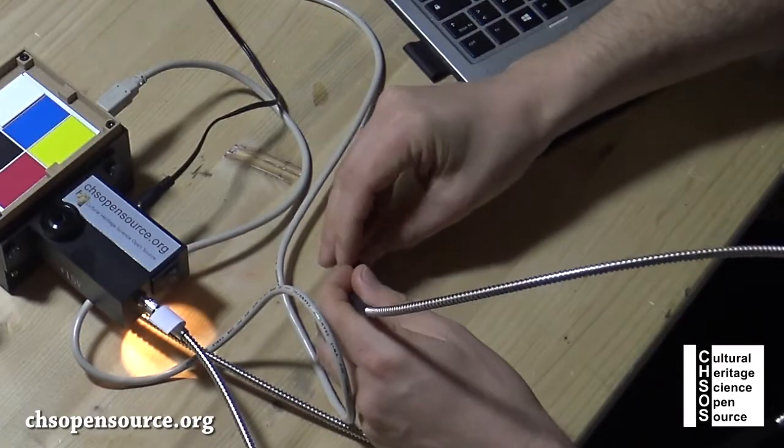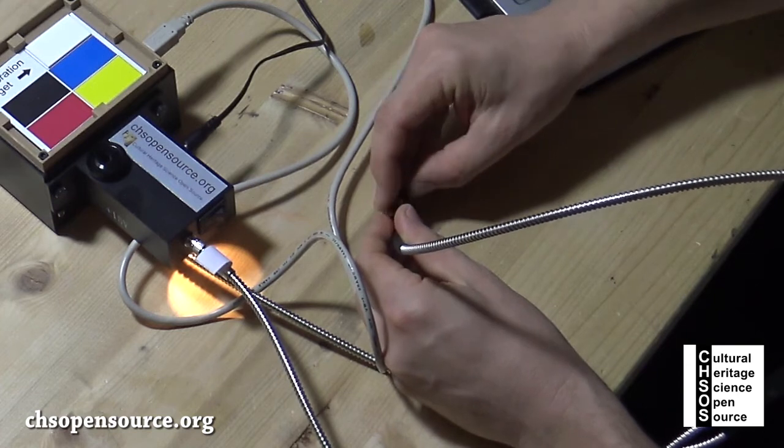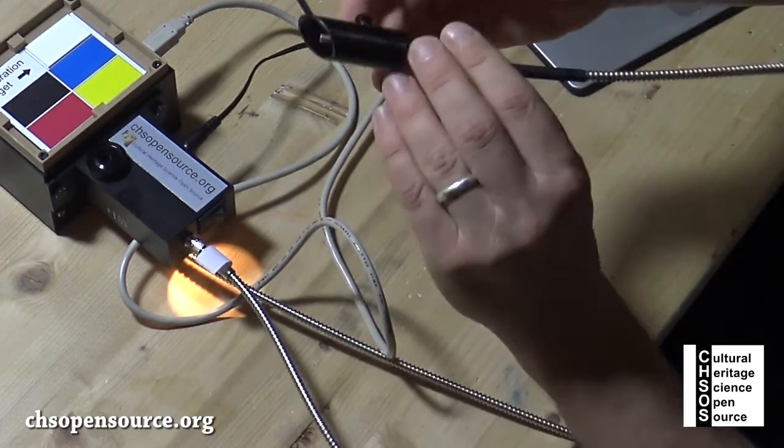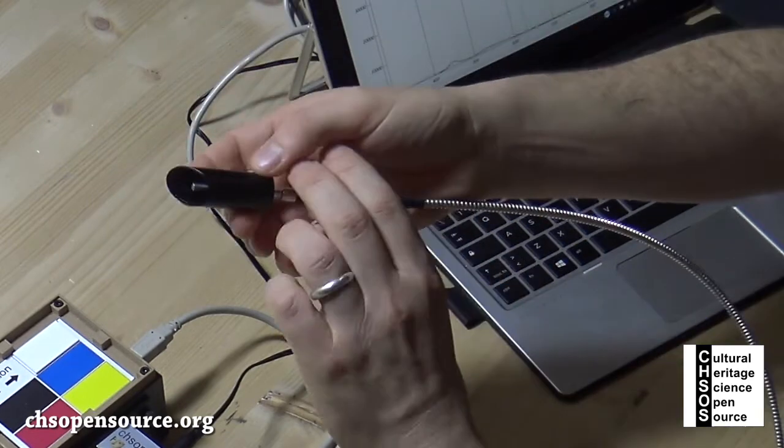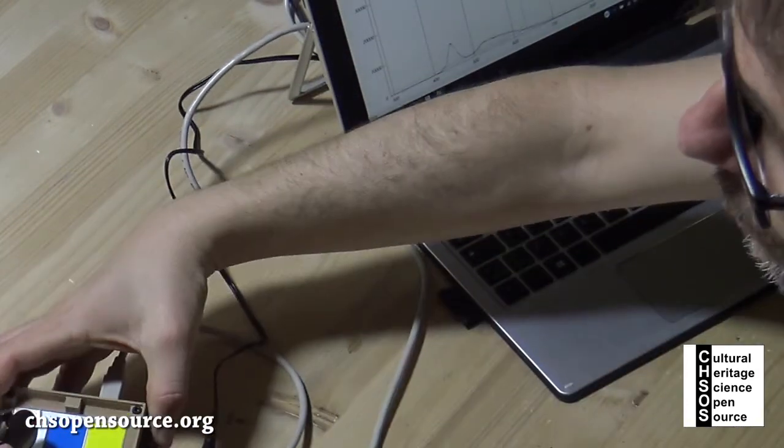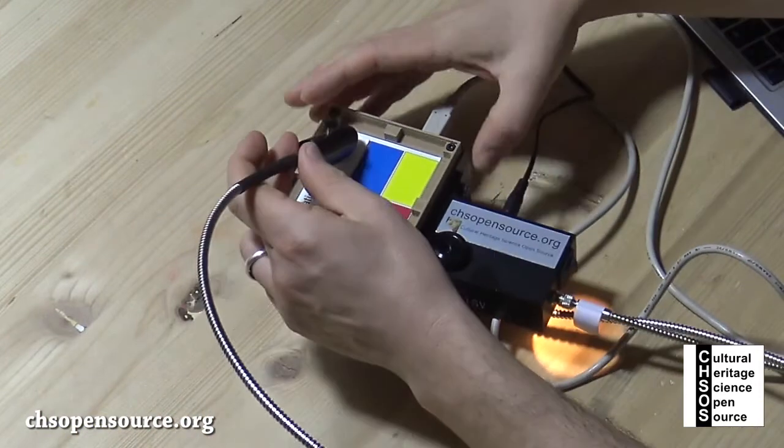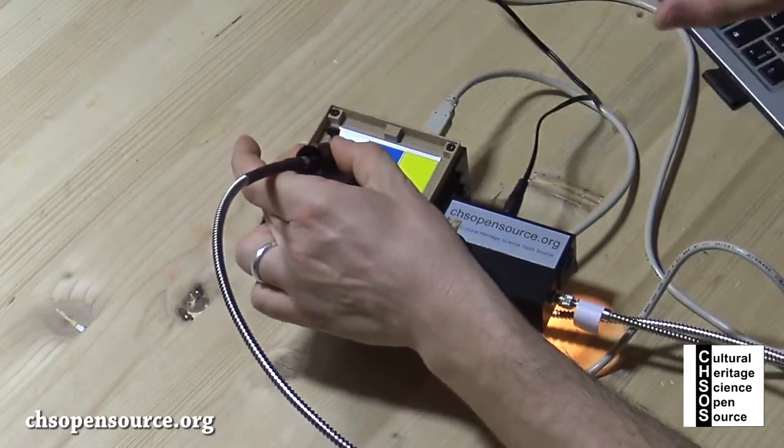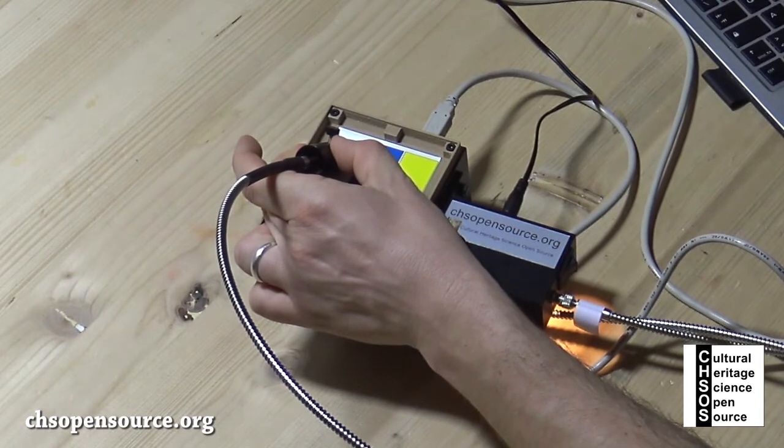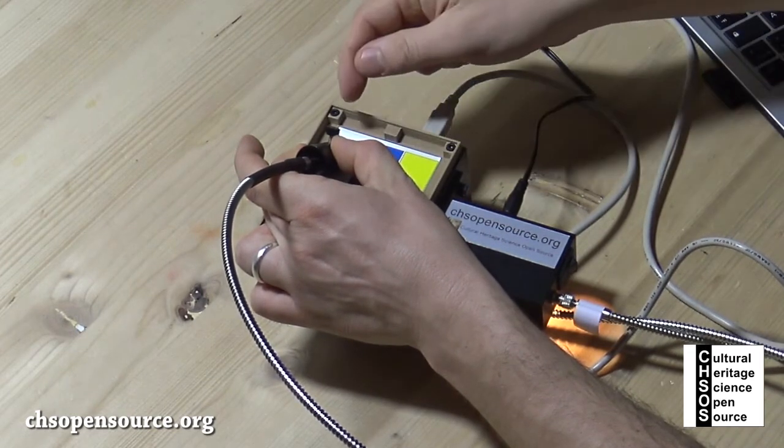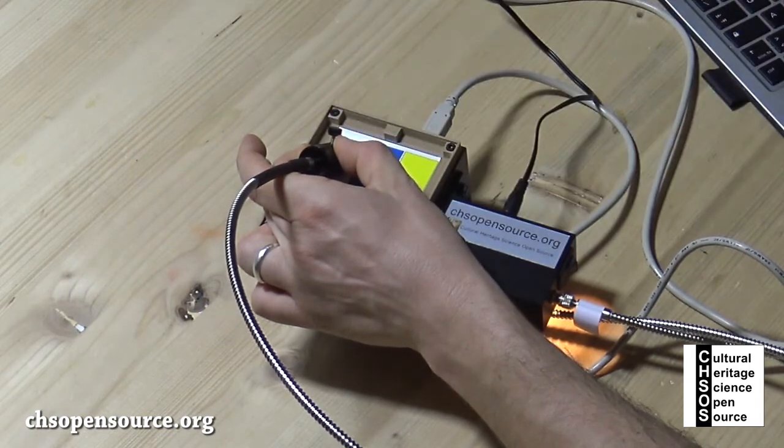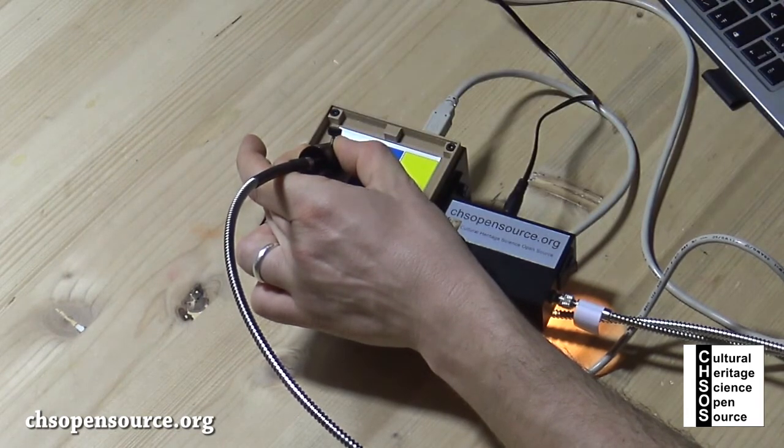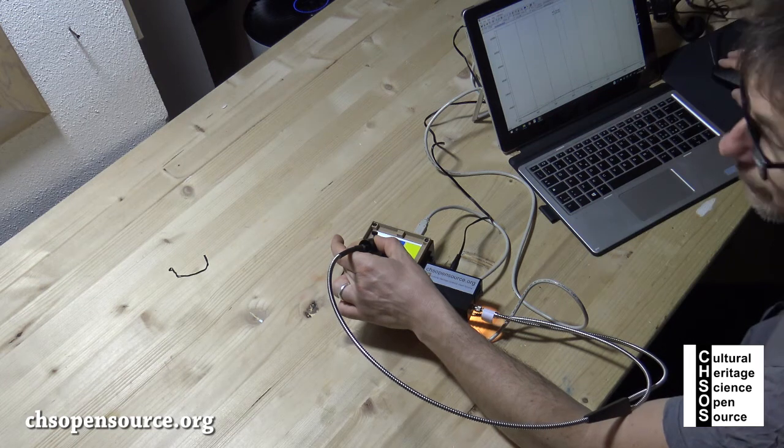Let's now prepare the system for the acquisition. First of all we need to use this probe. This is the probe for an environment where there is a lot of light from external, like in this case. I have these LEDs to light the system here. Otherwise you can use without the probe. For now we use this probe.